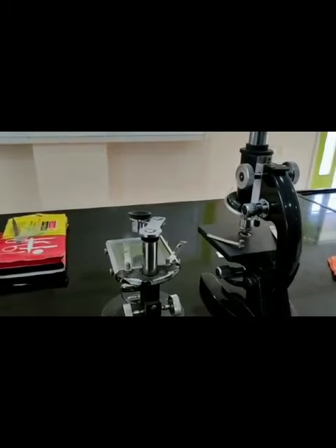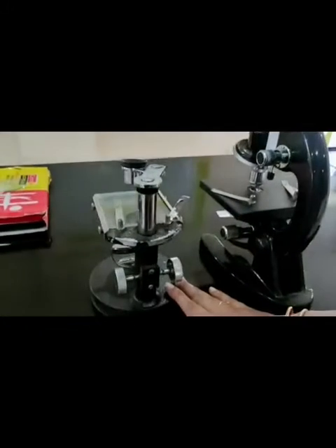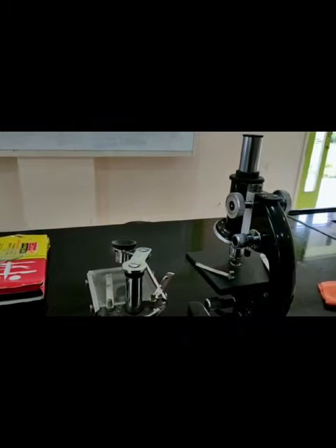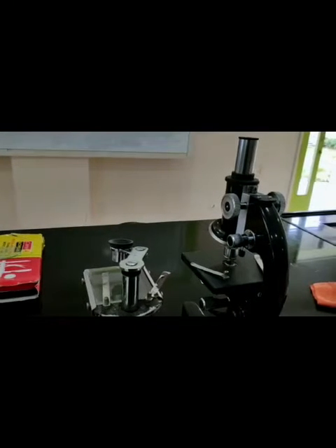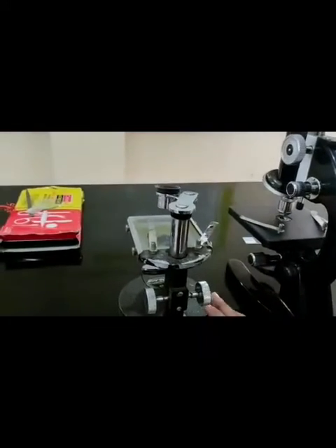The experiment name is 'Study of Parts of Compound Microscope and the Simple Microscope.' As you can see, we have two microscopes here. The first one is called the simple microscope and the second is the compound microscope. Microscope is the most essential instrument used in biological practical. Anton van Leeuwenhoek in 1675 AD discovered the microscope, and for that he is called the father of microbiology.